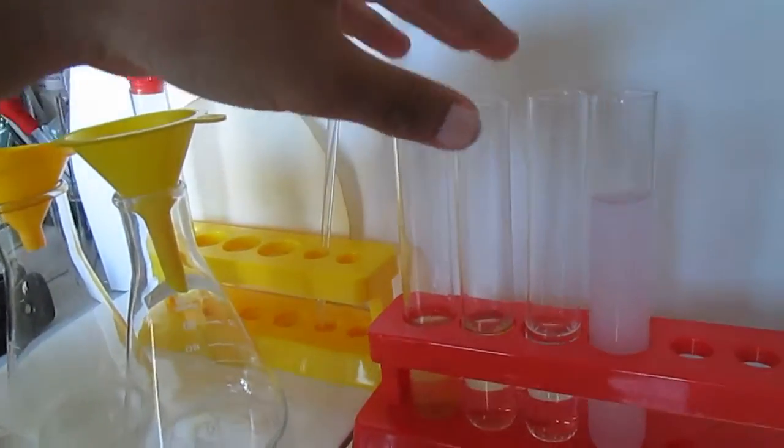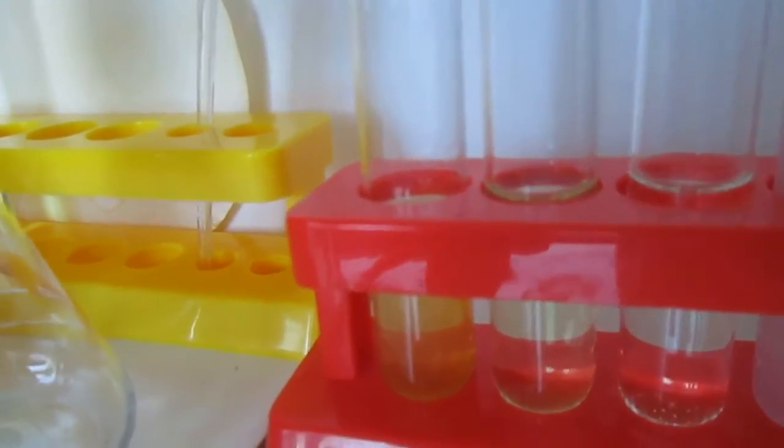In this second test tube I made a solution of potassium ferrocyanide. It is a very clear, very pale, yellowish solution.